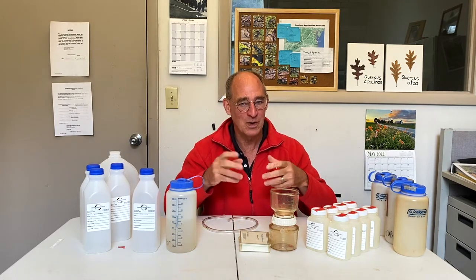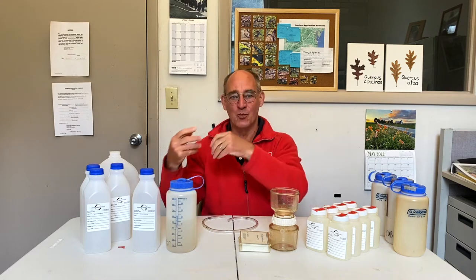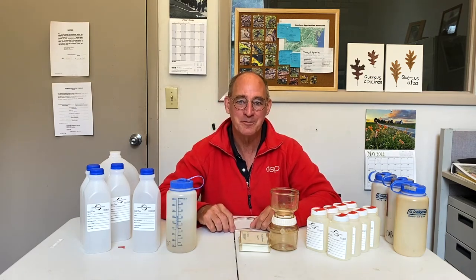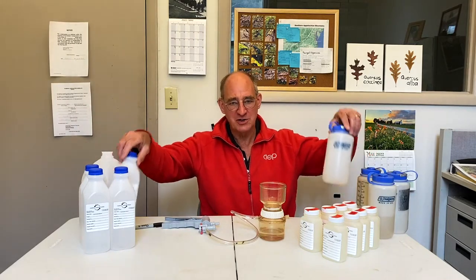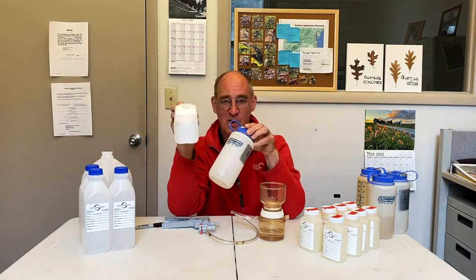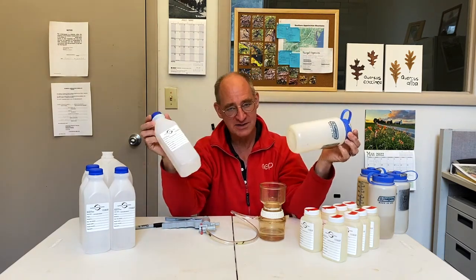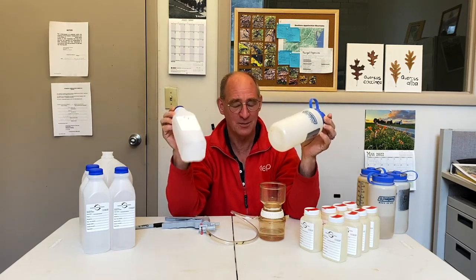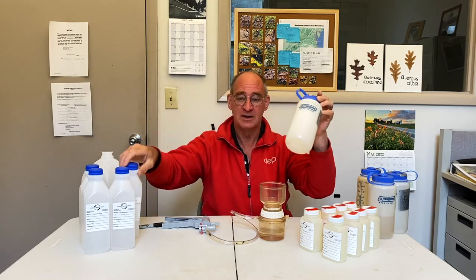And now what we want to do is distinguish what was dissolved in the water from what was just floating in the water, what we call suspended. So after coming back from a sampling day, we have a bunch of pairs of bottles like this full of water and bottles like this full of water. On some runs, for instance, we come back with 17 pairs of bottles.